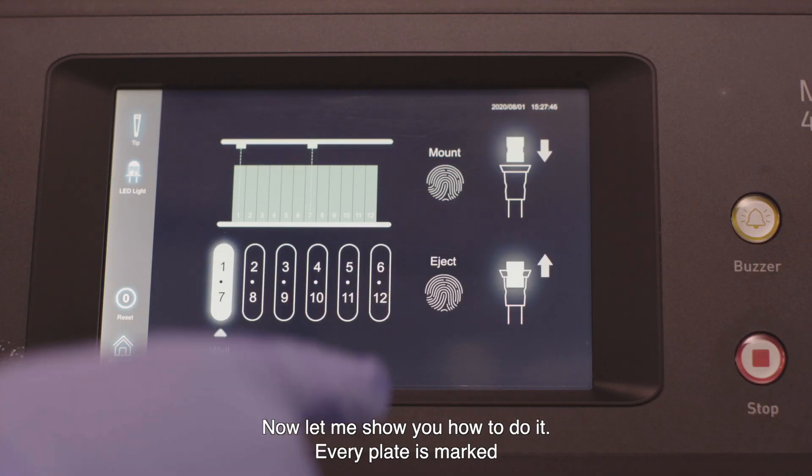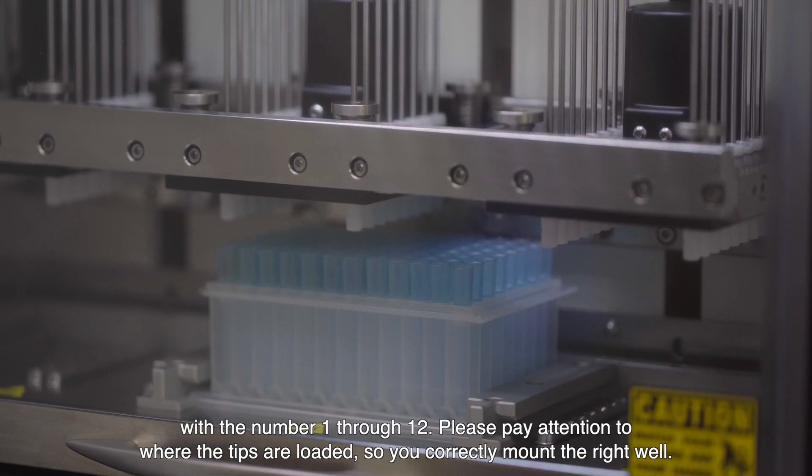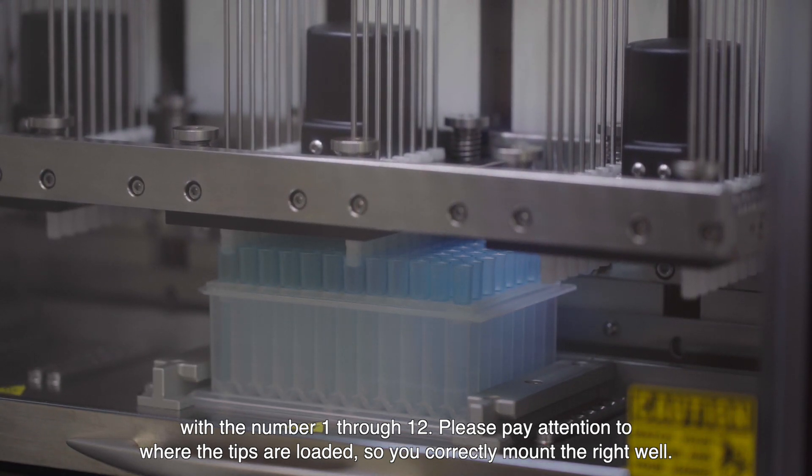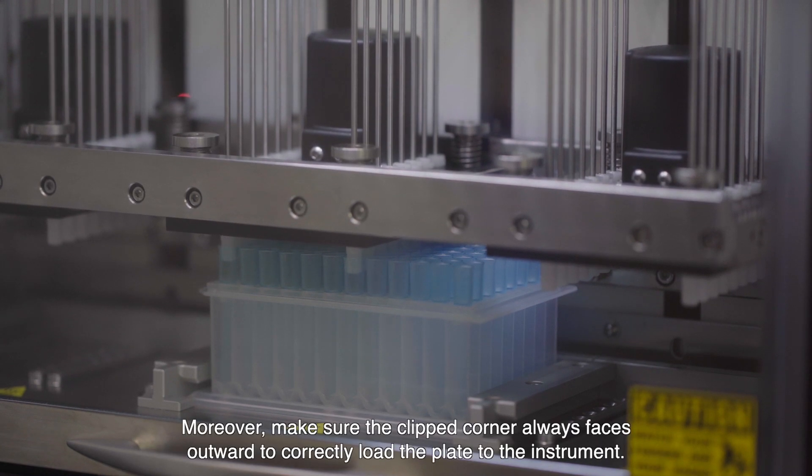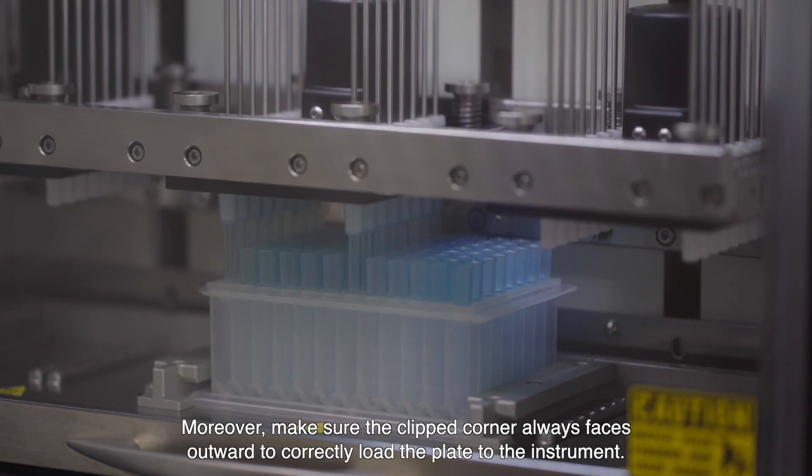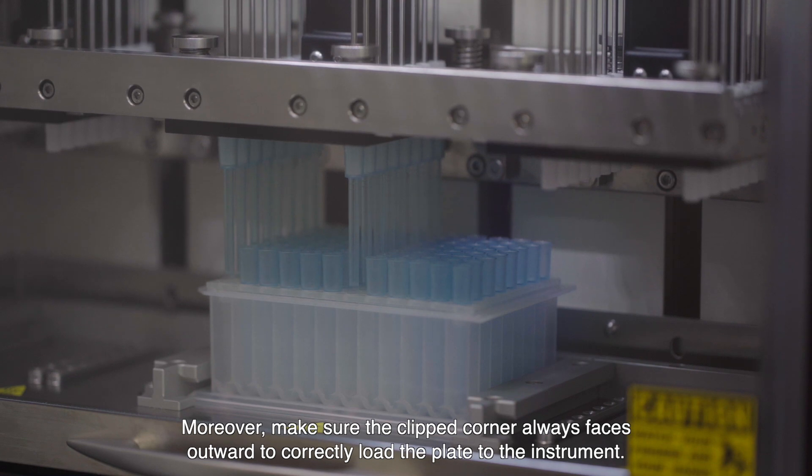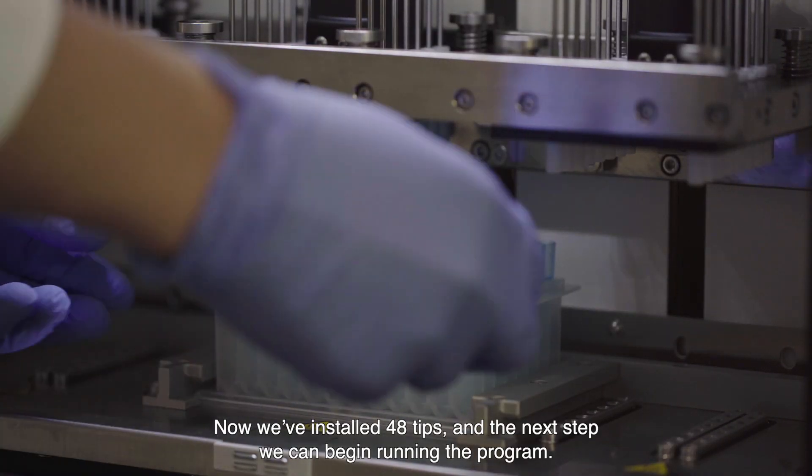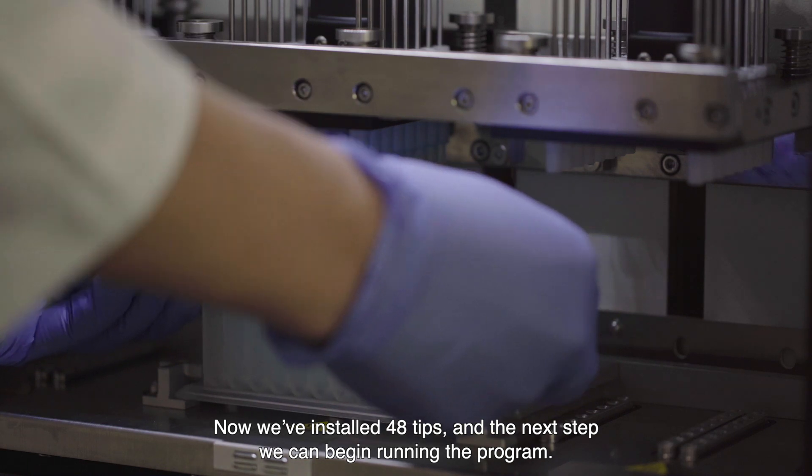Every plate is marked with the number 1 through 12. Please pay attention to where the tips are loaded so you correctly mount the right well. Moreover, make sure the clipped corner always faces outward to correctly load the plate to the instrument. Now we've installed 48 tips and the next step we can begin running the program.